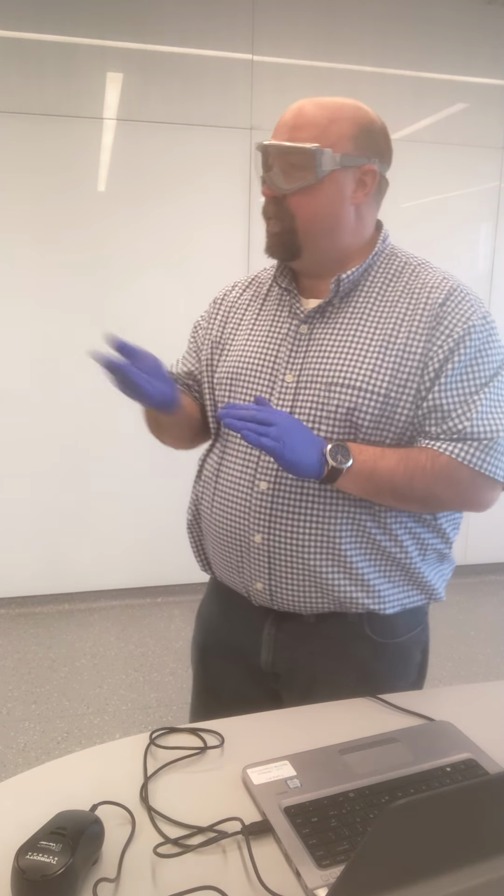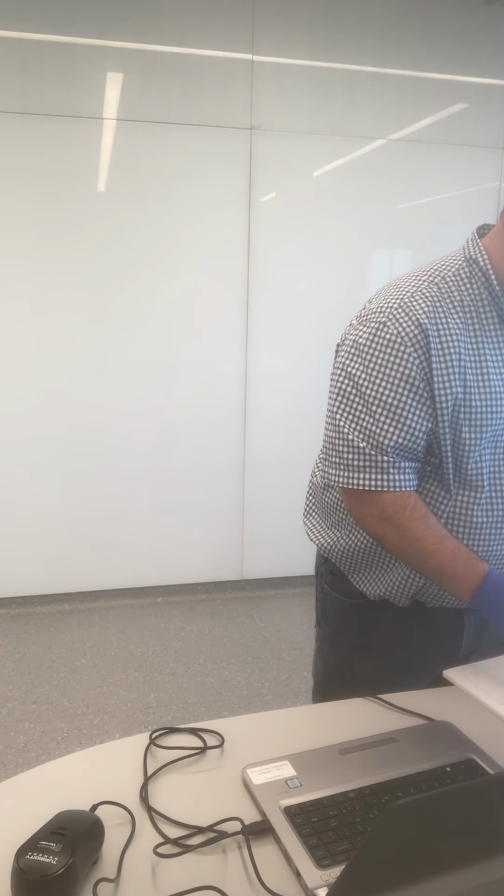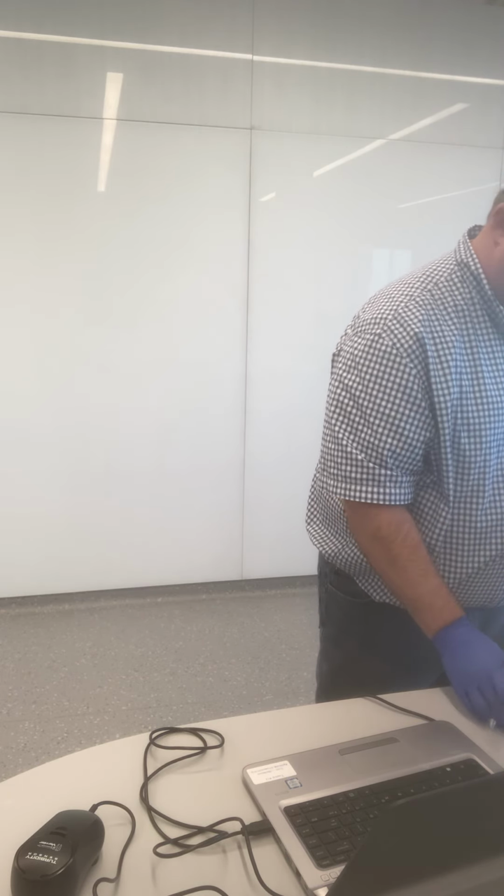Then all you'll have to do is take the difference, and that difference will be the amount of the actual solid. I'm just going to go grab my notebook so that I'm able to record all of the data for you as we go. And so here we go with Module 1.